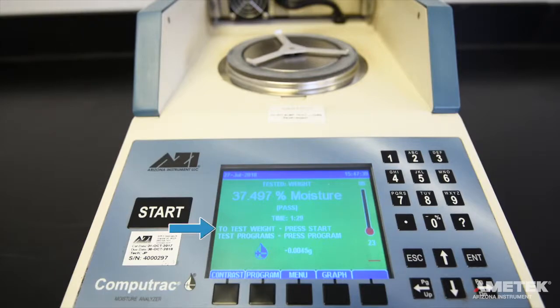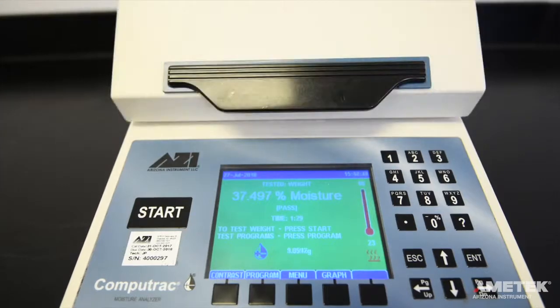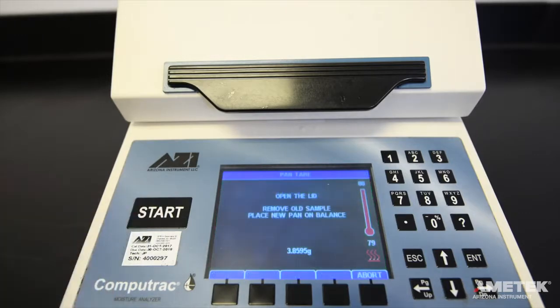The test line will now read weight test. Press the start button and the instrument will start to warm up until it reaches the programmed idle temperature of 80 degrees Celsius, which is noted at the top of the on-screen thermometer. Once the instrument reaches 80 degrees, press start and follow the on-screen instructions to perform the weight test.